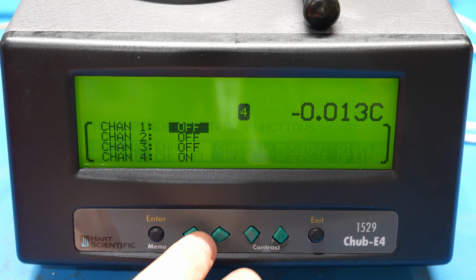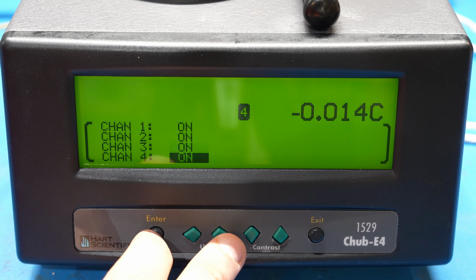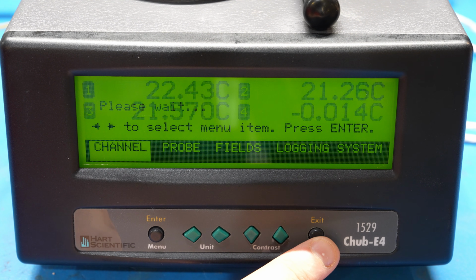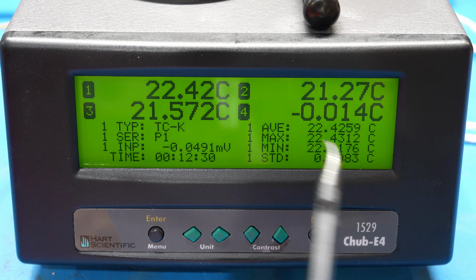But yeah, this looks like it is indeed functional now, which is pretty good. Now let's go back to see if it makes all the measurements again. And it should look good. And here we go. So you can see it also stores a whole bunch of statistical data.